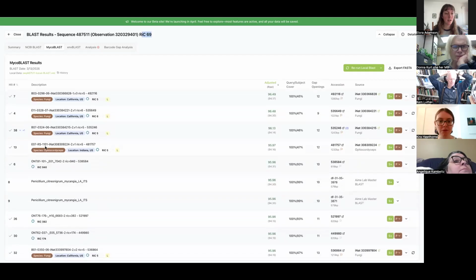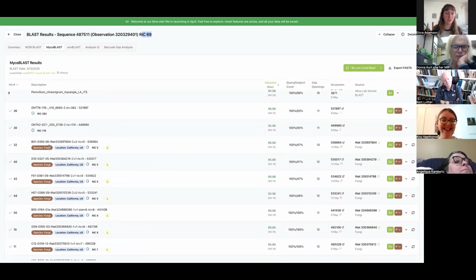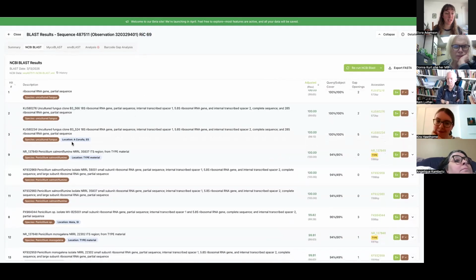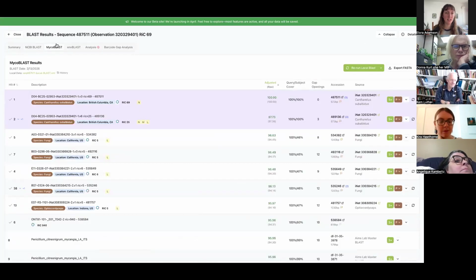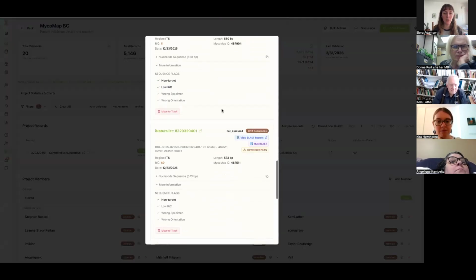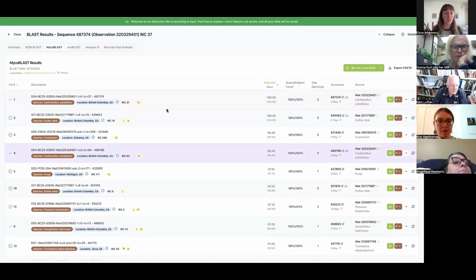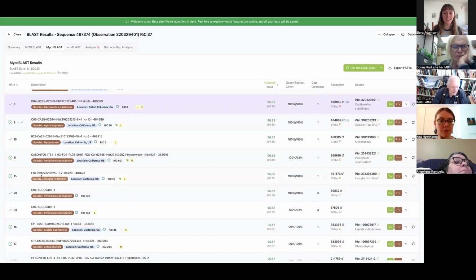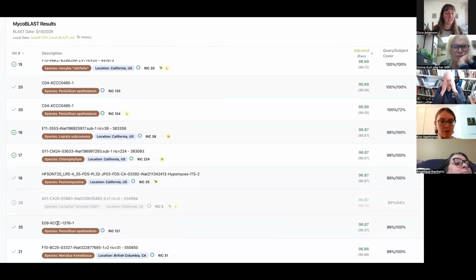69 reads, Ophiocordyceps right off the bat. Looks bad, keep scrolling, looks horrible. If I look at GenBank, it's just going to be the same uncultured fungus. Like these are all just contaminants. Where are we? Non-target, it already knows. 37 reads. Non-target, looks the same. Inocybe, Mycena, Chlorophyllum.